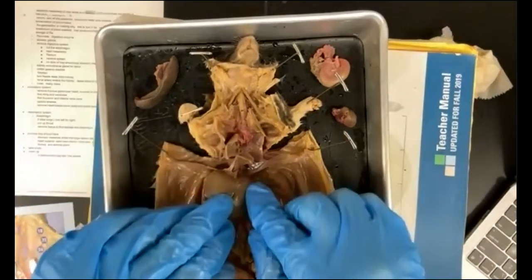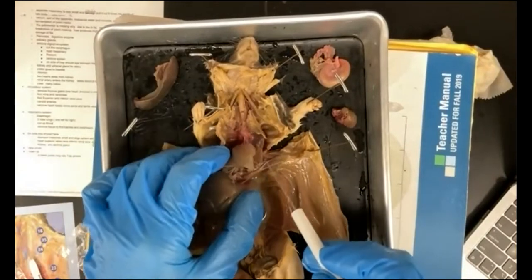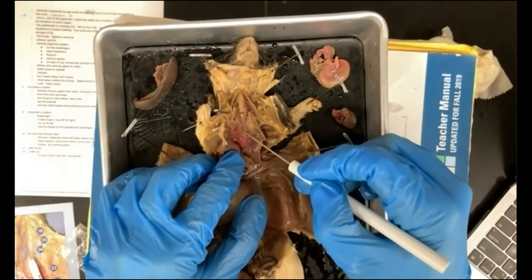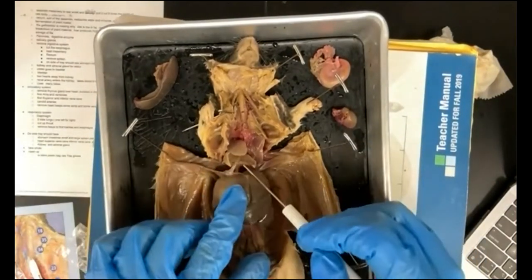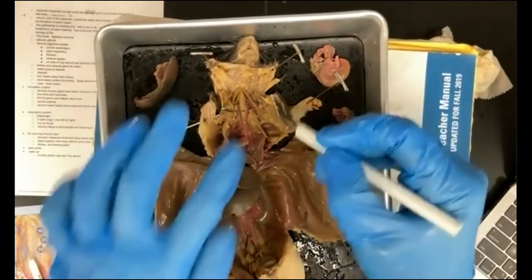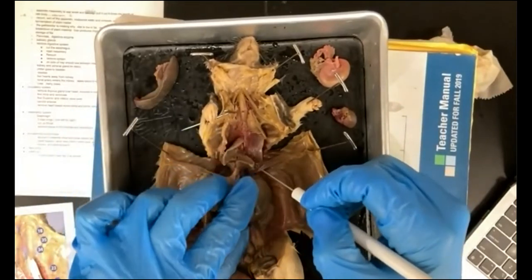Okay, so liver, clearly the largest organ. The diaphragm we broke through. So this leaves us here with the lungs. Okay, so these are the lungs right here. And we would expect the trachea then to be leading down into the lungs. So the lungs are 5-lobed, right? Which is different for us. So there are 5 lobes, and we have the trachea, which then splits into the bronchi, right, into 2 tubes that lead into the lungs.